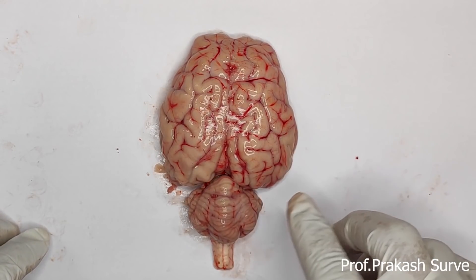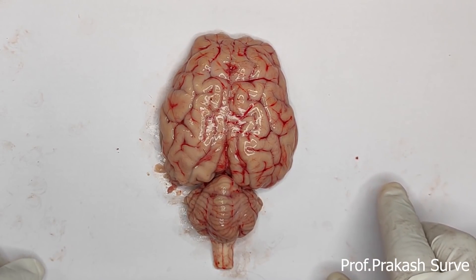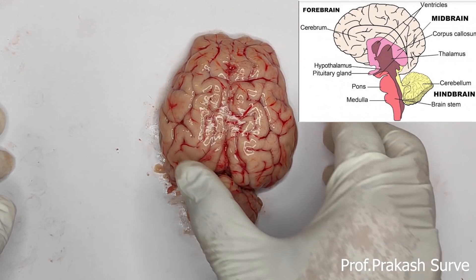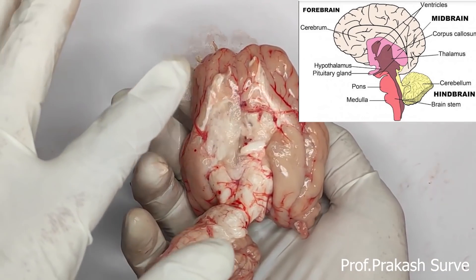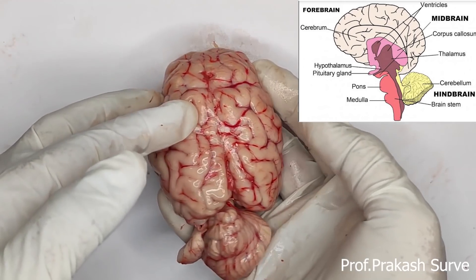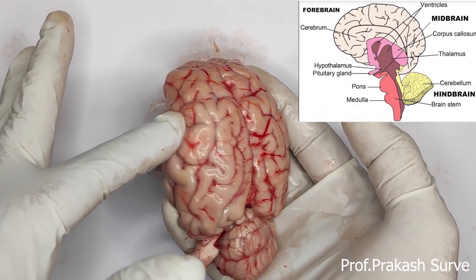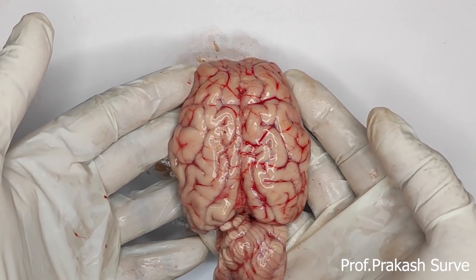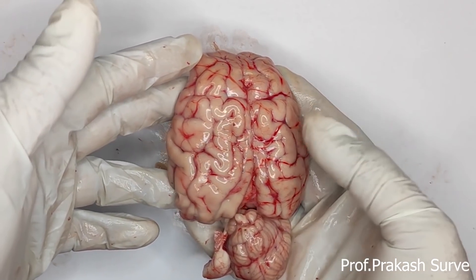Now we will see the different parts of the brain. The brain is mainly divided into three parts: the forebrain, the midbrain, and the hindbrain. The forebrain consists of the olfactory lobe, the cerebrum, and the diencephalon. We will first discuss the forebrain, then move to the midbrain, and then to the hindbrain.